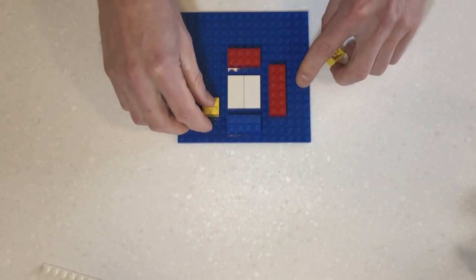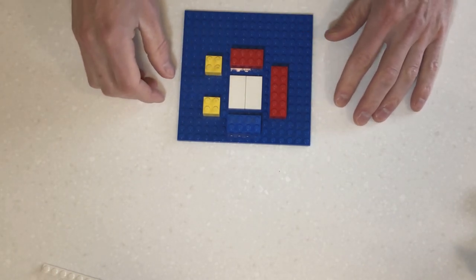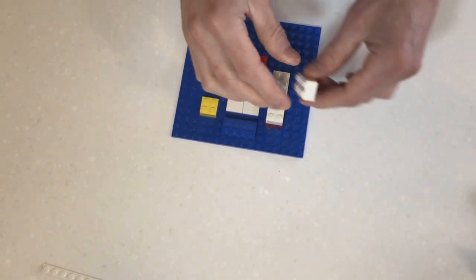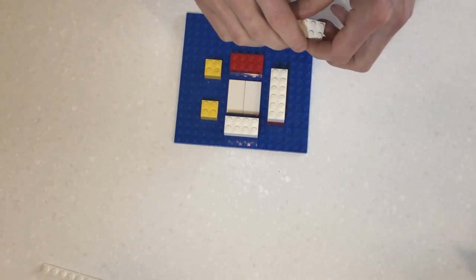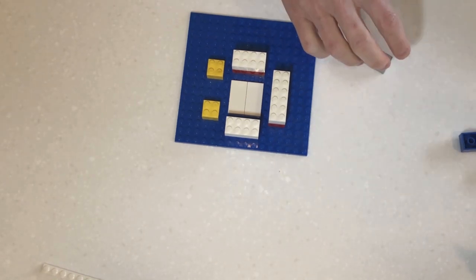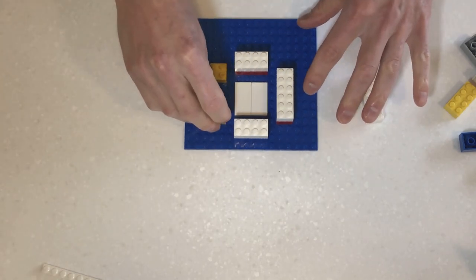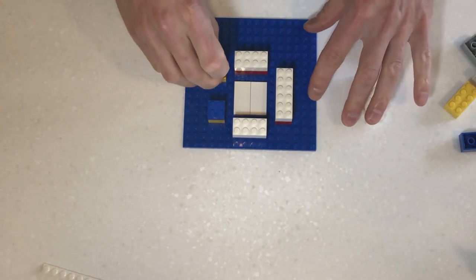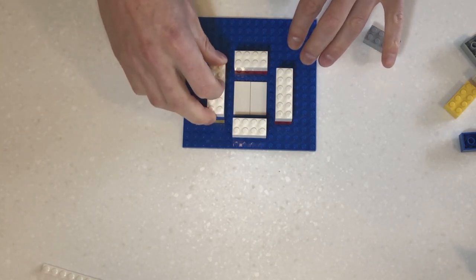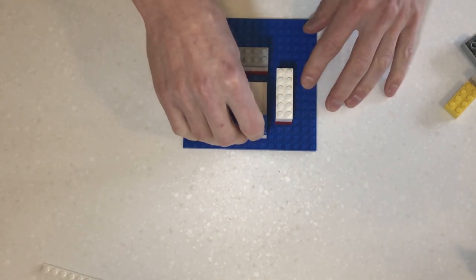Okay, you'll notice here that I'm going to leave a gap to this edge here. This is where we're going to introduce our samples into the microscope. I'm now going to build up another layer. And I've introduced a hole here. I can just cover that. Build up three layers here.